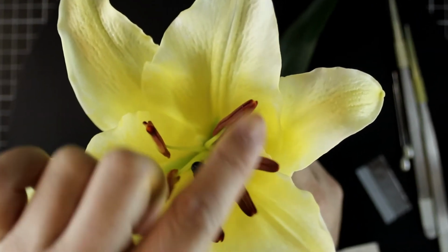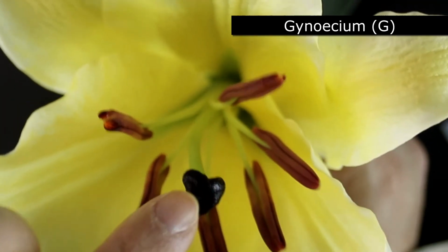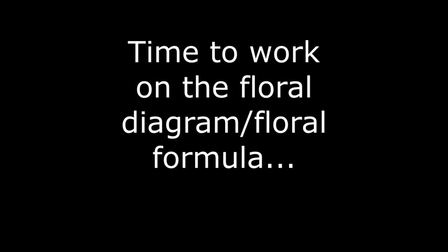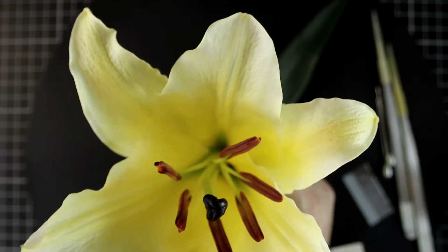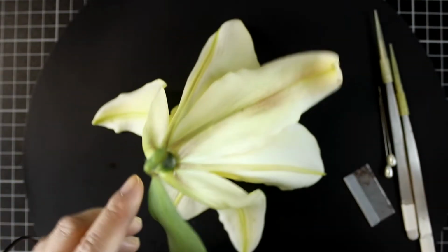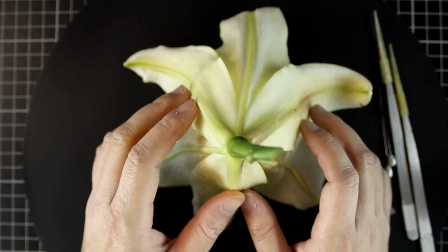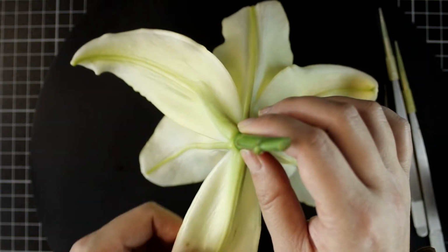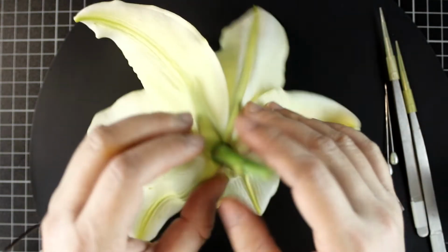Here I show you the stamen, so they belong to the male part, androecium. And the middle one is gynoecium, the female part. The next question is whether these parts are fused together or not. Let's look at the bottom side. First of all, I'll remove the leaf so you can see it clearly. From the bottom side, you can see that each tepal is well separated, so they are not fused together.